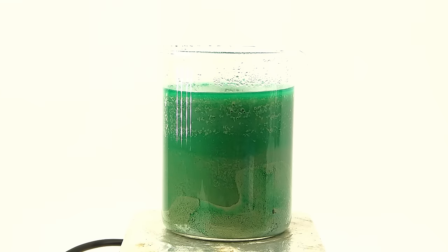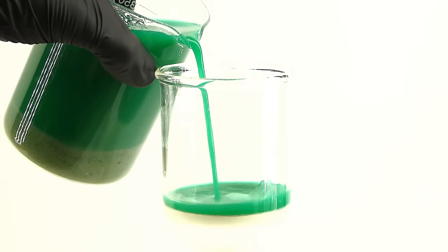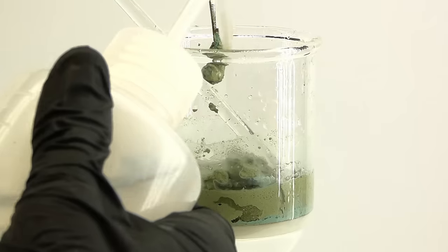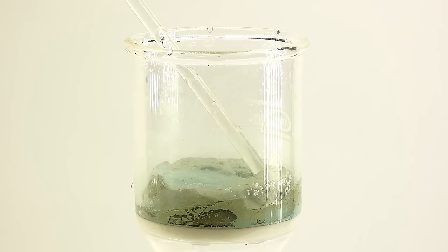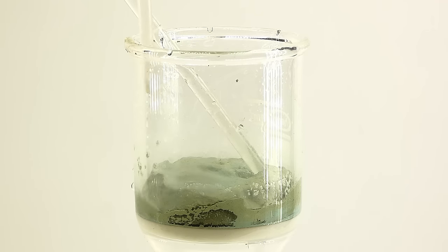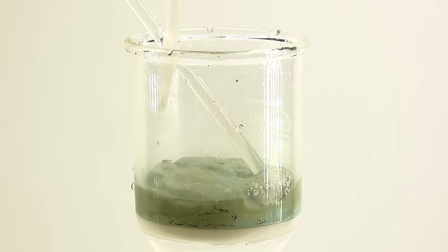When I came back in the morning, the solution turned green for some reason, and now all this silver should be floating around as a powder. To get it out of the beaker, I vacuum filtered everything and removed the now much smaller beads of copper using a pair of tweezers. I then washed the silver a few times with a lot of distilled water, to get rid of any leftover copper nitrate.